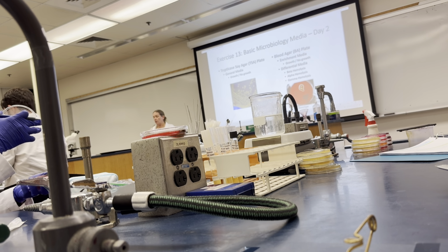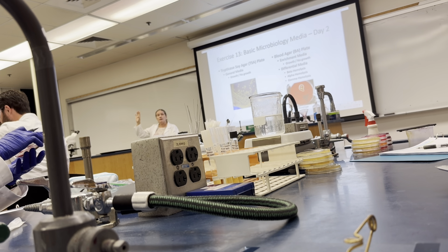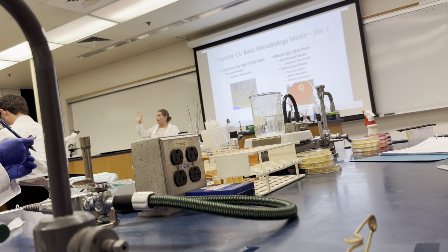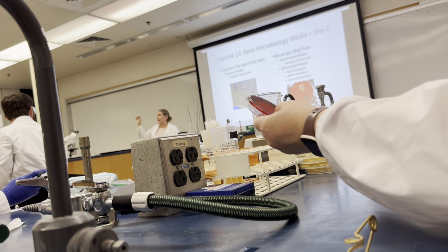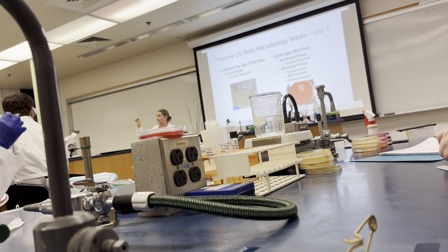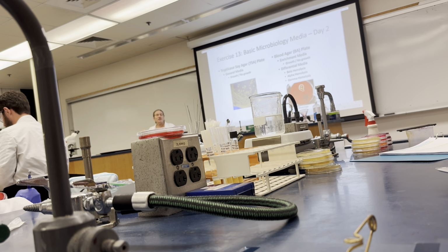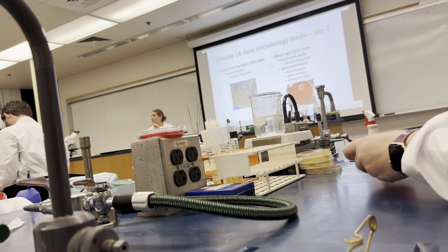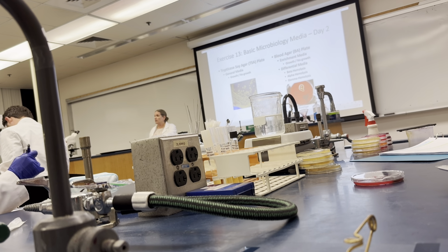So, to start off with, for your observations, number one, enrichment media: which organisms grew on these plates? The enrichment media fact is growth or no growth. Which organisms grow on the plate? All of them, thank you. All of them grew on the plate. Now, as far as the hemolysis pattern, this is the second bit of information that you get from this plate. The hemolysis pattern has to do with the differential component, the red blood cells being present that might be broken down by the bacteria.